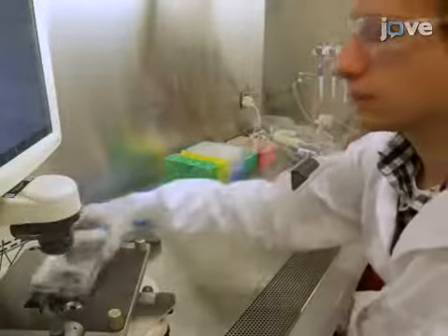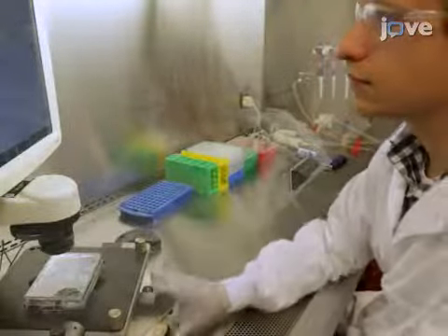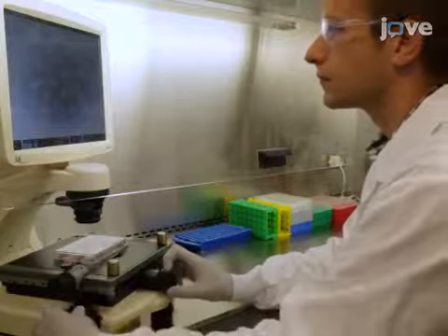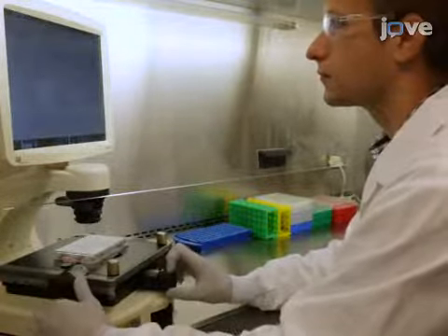Using regular stem cell maintenance methods, bring cultures to between 50 and 70% confluence. Inspect the cultures using bright field microscopy at 10 to 20x magnification and ensure that the colony has a healthy morphology with no detectable differentiation.